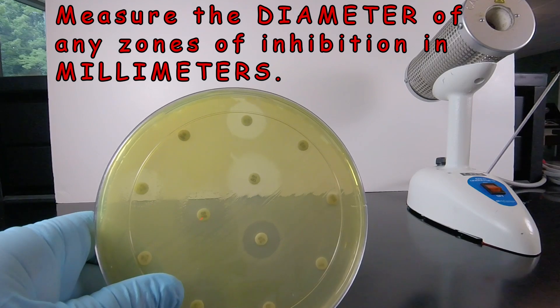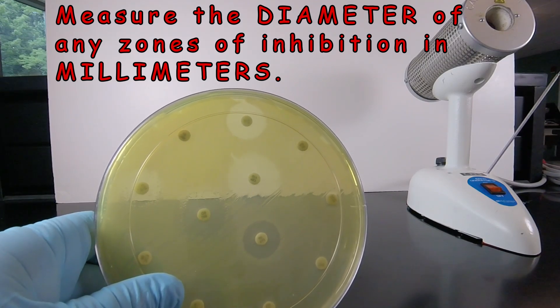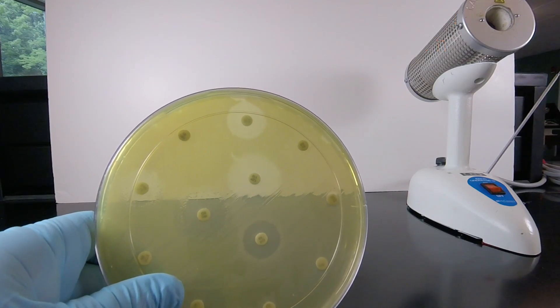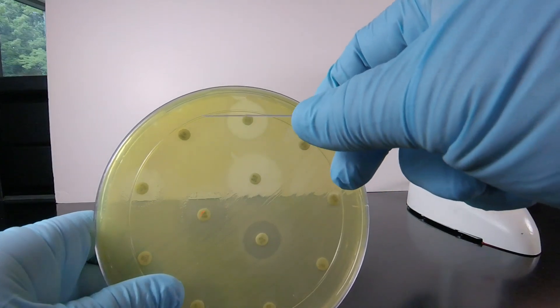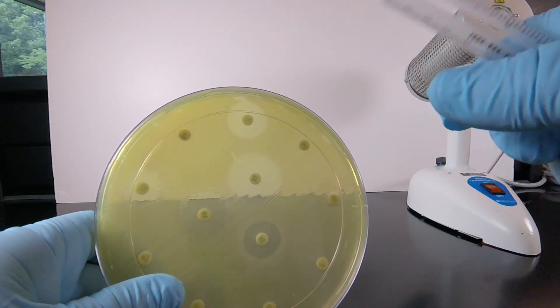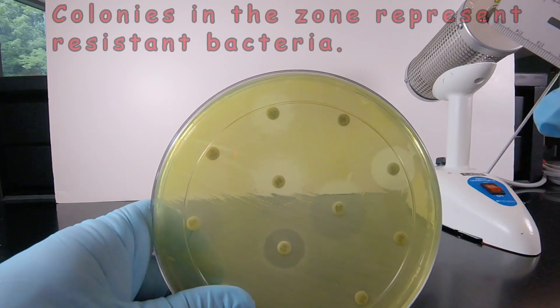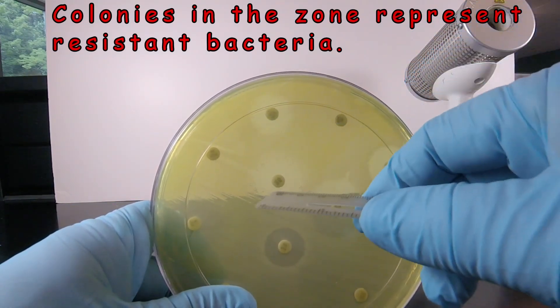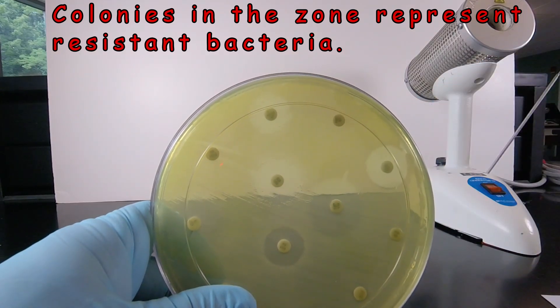Whether the organism is susceptible, resistant, or intermediate depends on the diameter of the zone of inhibition. Some of these have a nice clear zone that can easily be measured, but you'll also notice that some have colonies in the zone — and those are resistant bacteria.